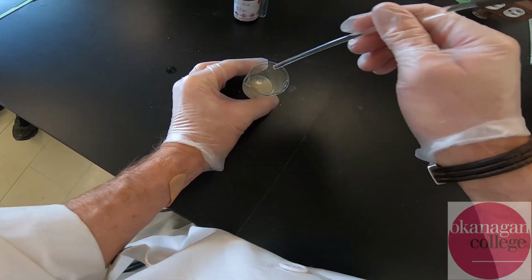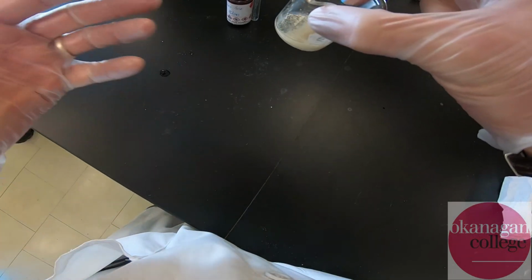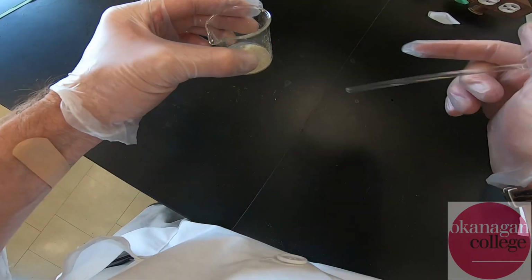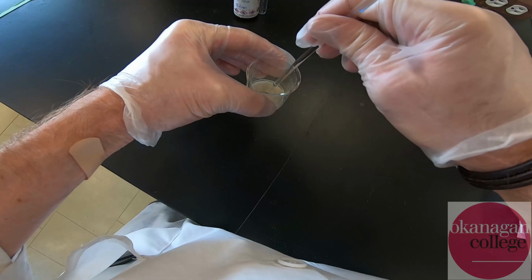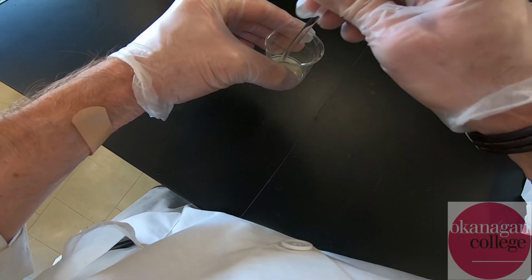Okay, so after a little bit of frustration and some novel approaches of using a stir rod as a pestle, we've been able to pulverize this material quite convincingly, producing a large surface area and allowing the acid to interact with the insoluble final product. This is the final dehydration reaction forming an enone of the final product.